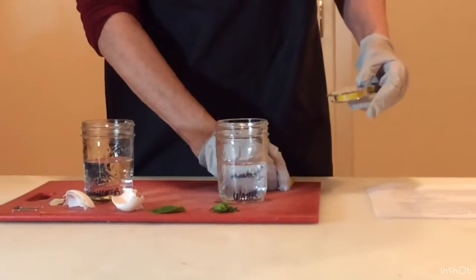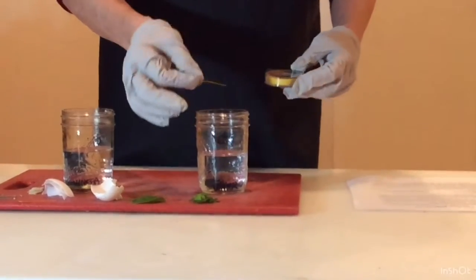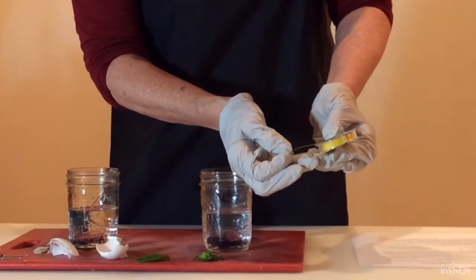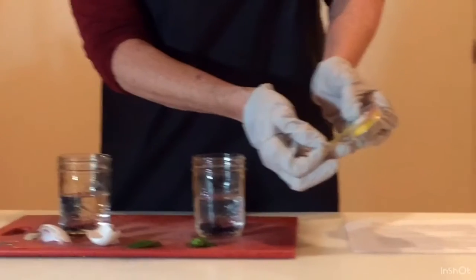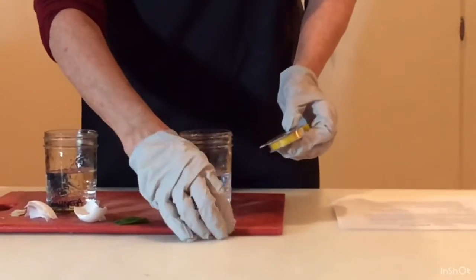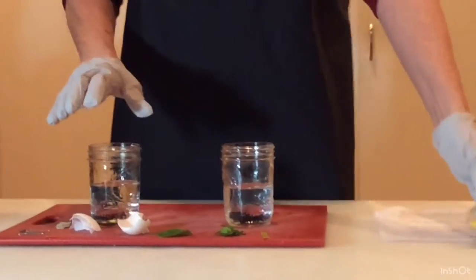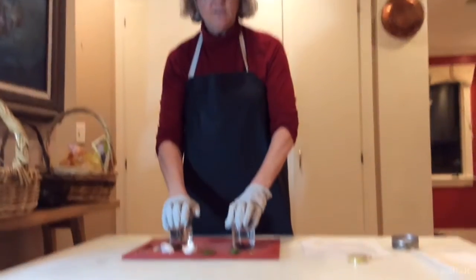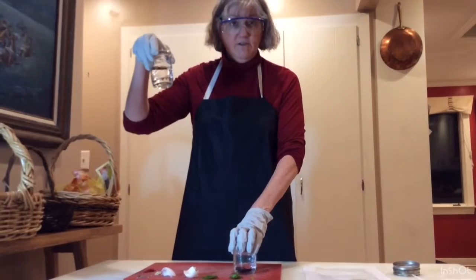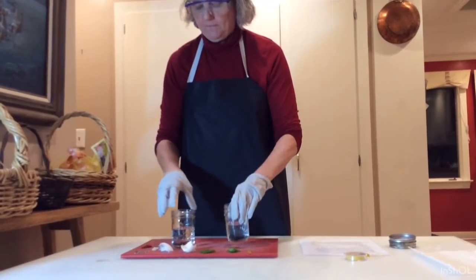Now you compare it just to tap water. Get it in. Notice it's much greener. And you go around and you see that it is somewhere probably around 6.5. So if you said this was 6 and this was 3, they're 3 units apart. But remember, that's not a threefold difference. Every 1 pH unit is a factor of 10. So this vinegar is 1,000 times more acidic than our natural water.